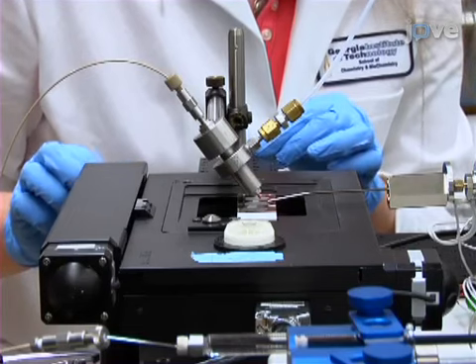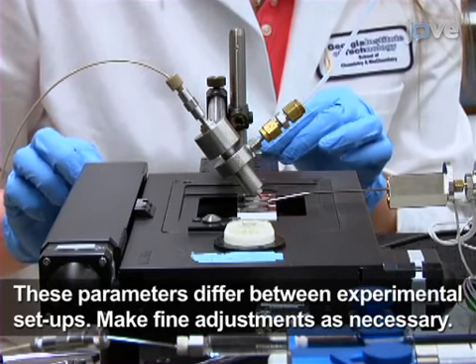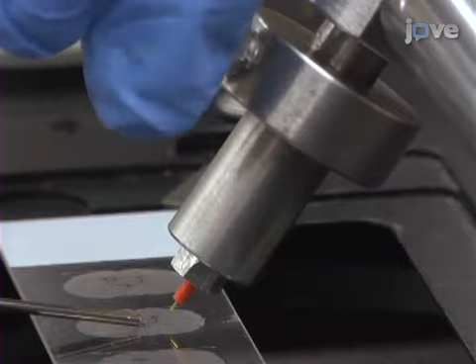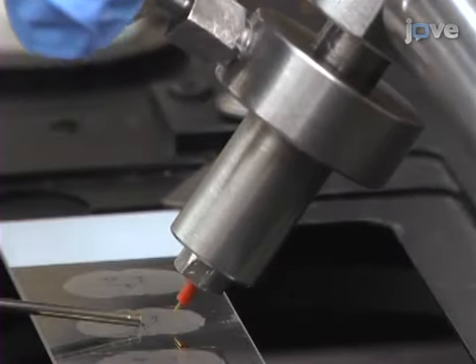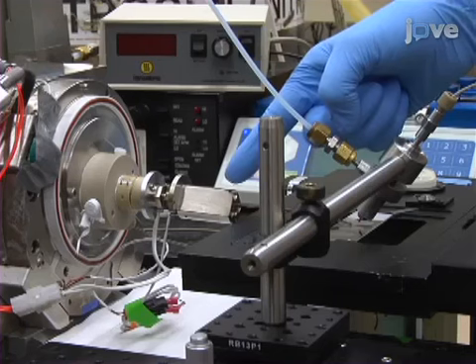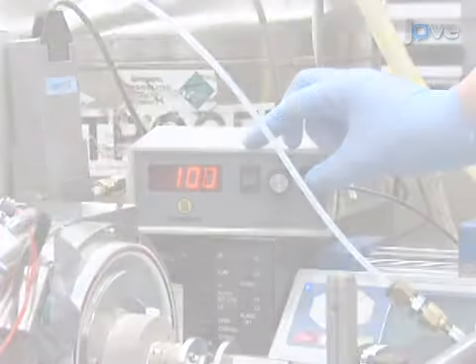Using the extra tissue section, set the Y separation between the source tip and the capillary inlet to about 4 millimeters and the Z separation between the tip and the sample surface to about 1.5 millimeters. Following this, adjust the distance that the inner capillary extrudes from the outer capillary of the source for maximum sensitivity and minimal impact spot size. The glare of light in the room on the microscope slide can be used to better see the impact spot. To improve the sensitivity during the ionization process, heat the transfer capillary using a rope heater or heating block to 100 degrees Celsius.